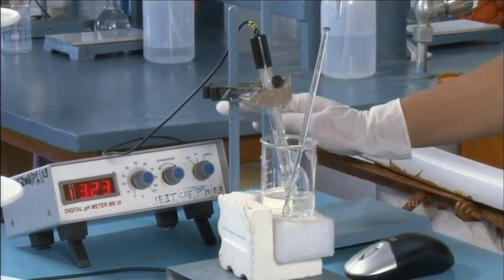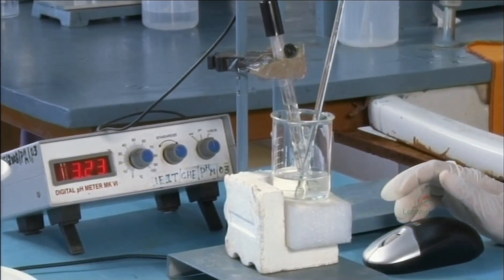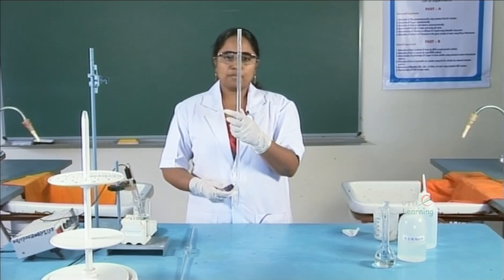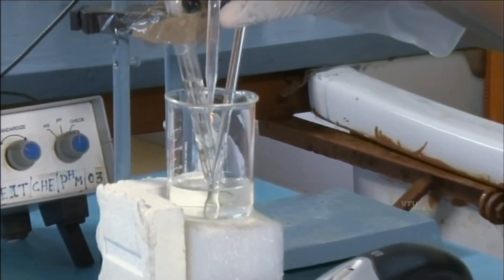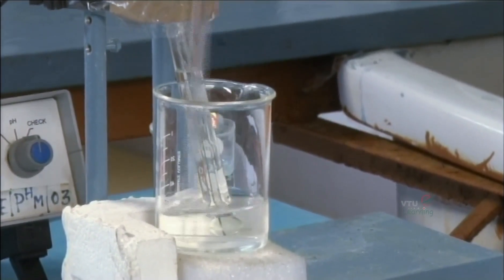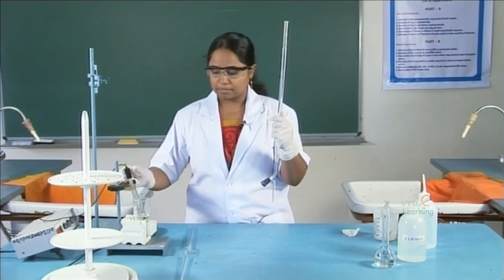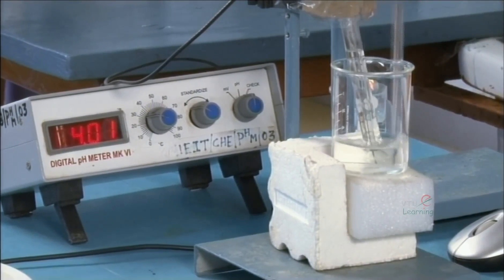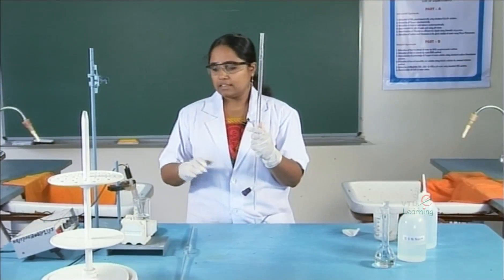Now the pH is 3.23. The readings have to be tabulated in a tabular column. I am going to add base in increments of 0.5 ml. After every addition, the solution has to be stirred and the pH reading noted. After adding 0 to 0.5 ml of base, the reading is 4.02. We can see that the reading goes on increasing.